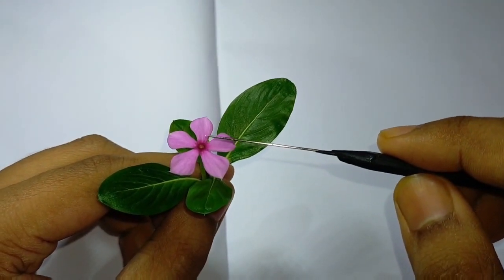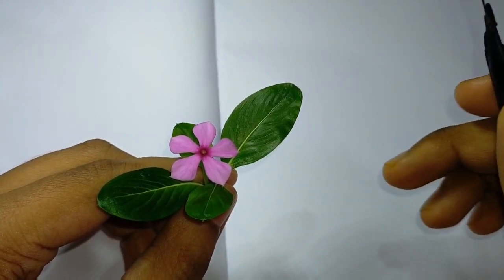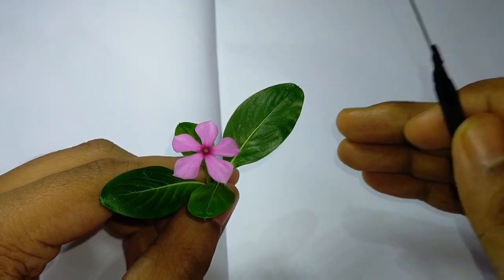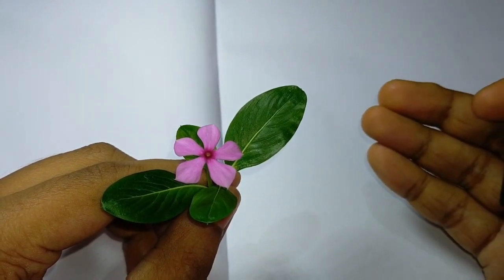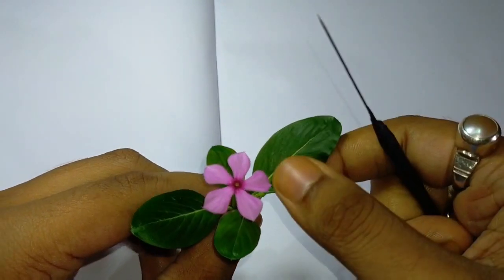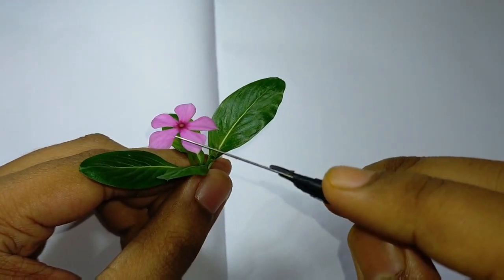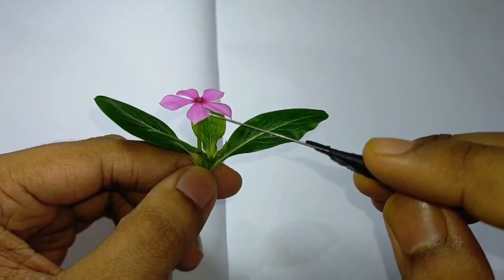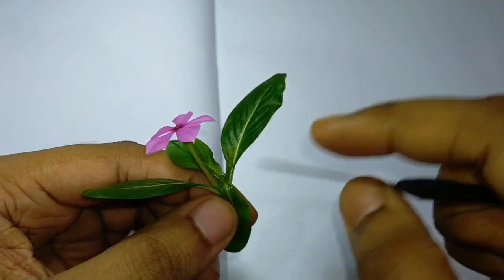The classification of this flower: it falls in the division Angiospermia, class is Dicotyledon, family is Apocynaceae, genus is Catharanthus, and species is roseus. Now the character of this flower — as you can see, the flower bears all the whorls of a complete flower.